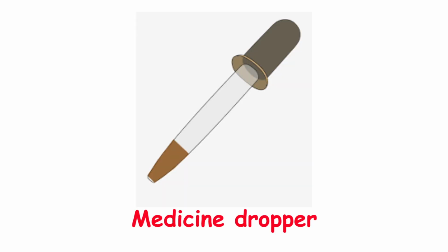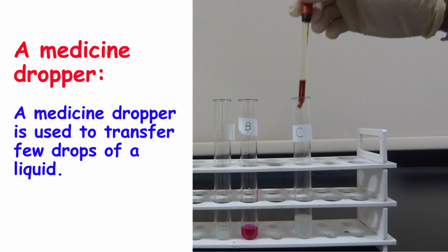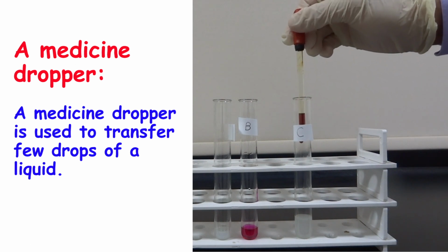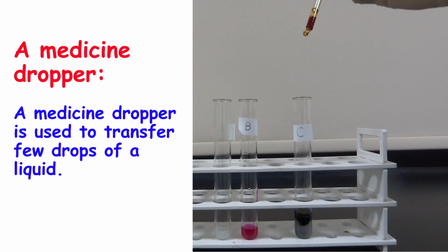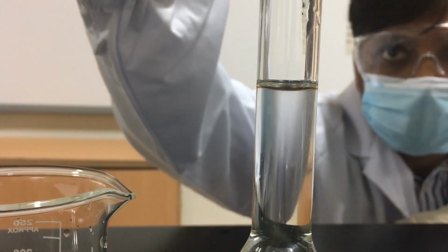Medicine dropper. From its name, it's clear that the medicine dropper is used to transfer a few drops of a liquid. In this example, the scientist is adding a few drops of iodine to detect the presence of starch, and here, a few drops are added to fix the volume of the liquid.